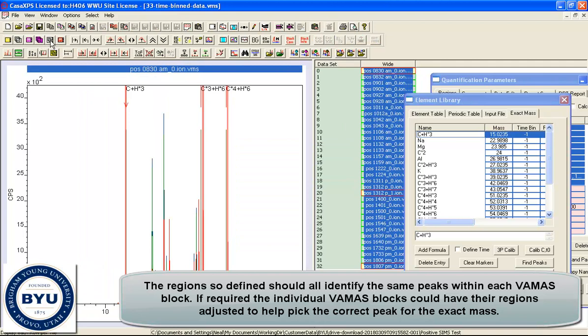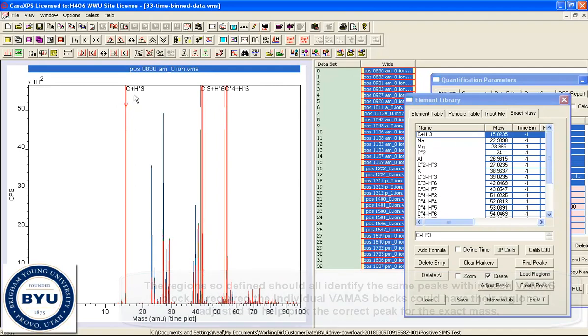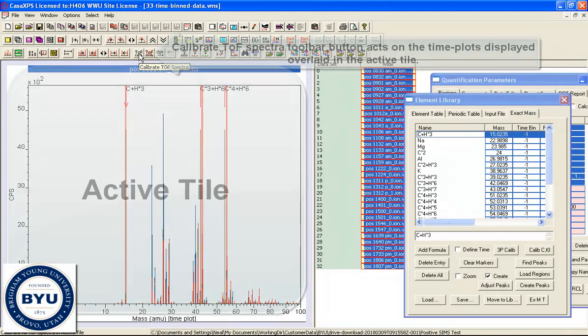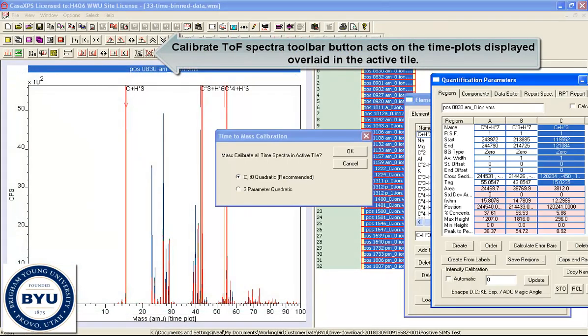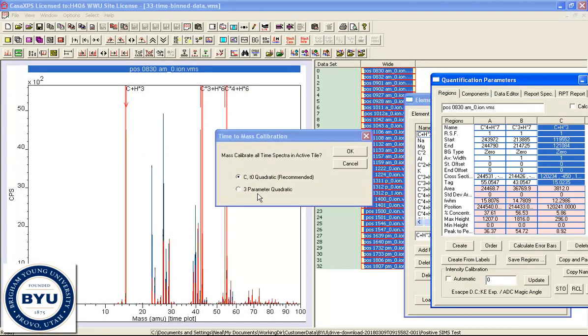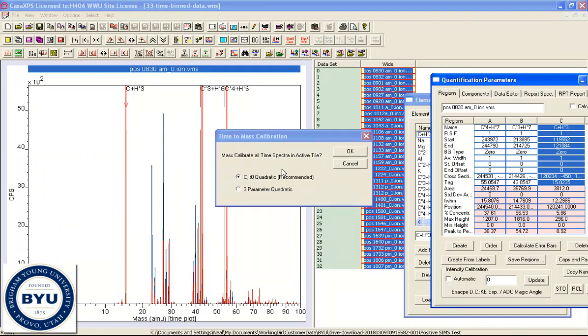And if we overlay these spectra, so overlaying these spectra in the active tile allows us to use some of these operations on this toolbar. So calibrate ToF spectra. Each one has 3 regions on it, so when I press the calibrate, a dialog window comes up and offers us 2 possible calibration options. One is using 2 parameters in a least squares fit, the other is 3 parameters for a quadratic, and the preferred one would be the 2 parameters. This is a much stiffer model and is more likely to give a consistent relationship between mass and time.